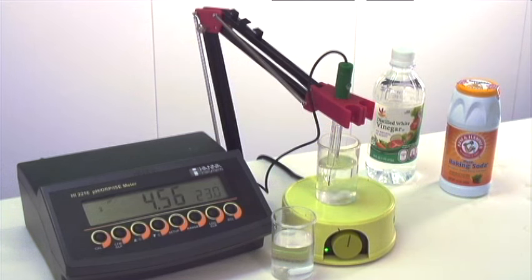With one drop, we can already see a drastic change in the pH. It went from about 7.3 to 7.4 all the way down to just over 4.5.